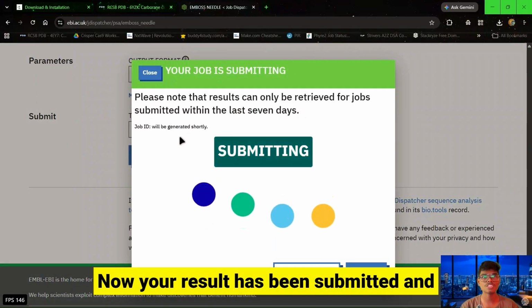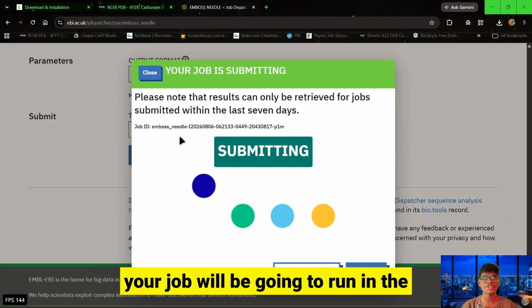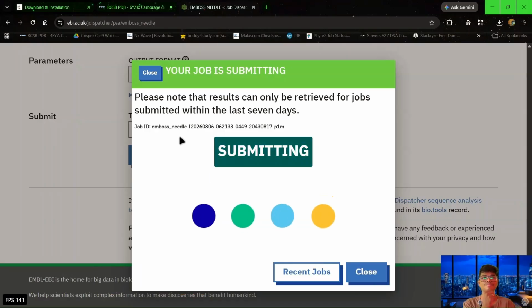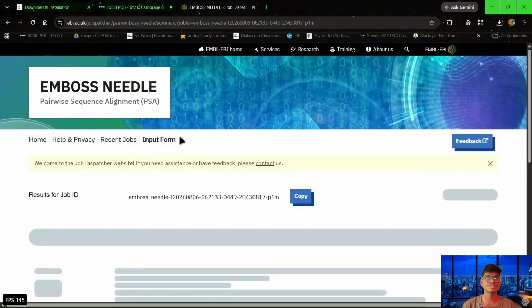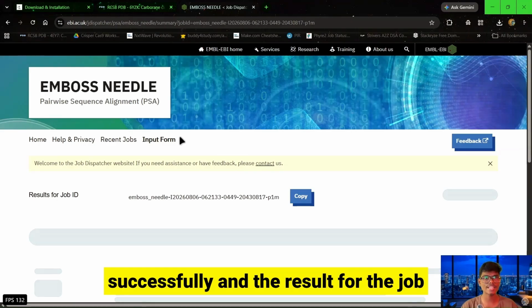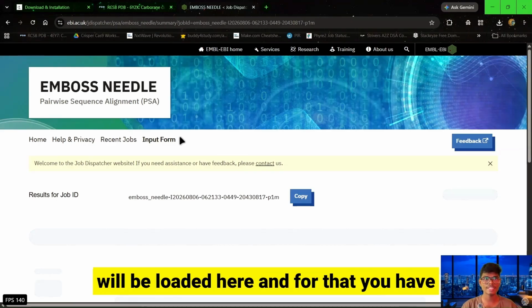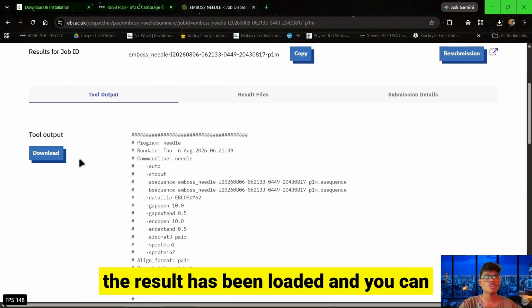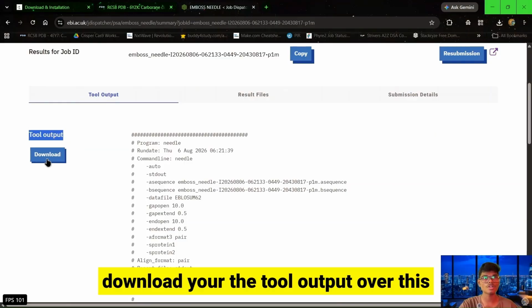Now your result has been submitted, and your job will run in the databases. After that, you will find the result page over here. Finally, the job has been completed successfully, and the result for the job will be loaded here. For that, you have to wait for the loading. So the result has been loaded, and you can download the tool output with this button.